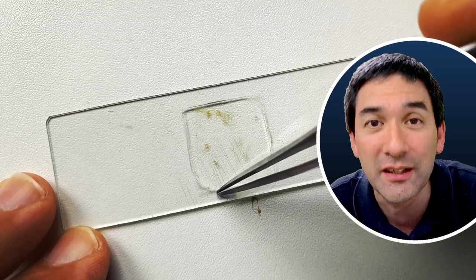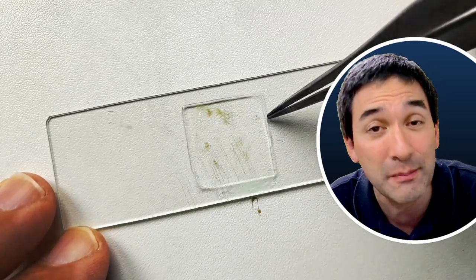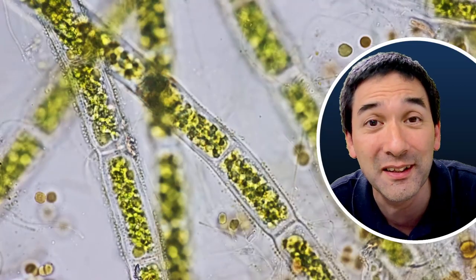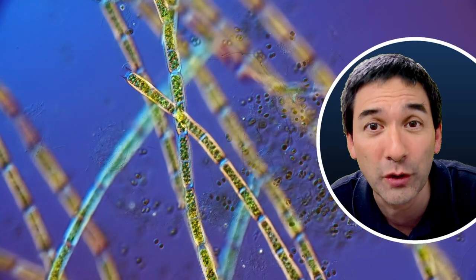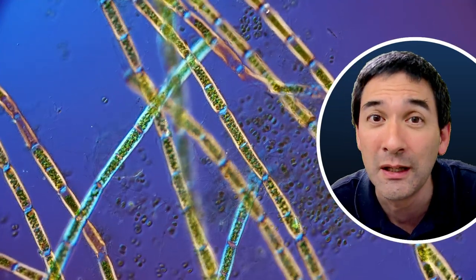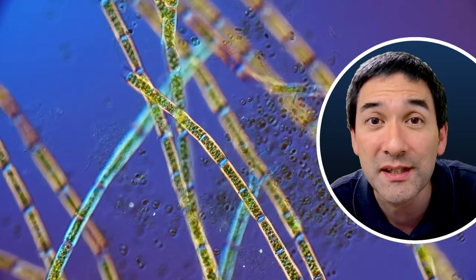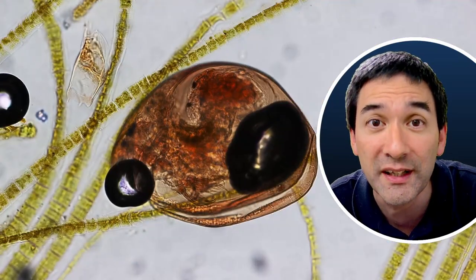I centered everything and then I let it dry for a few days and I was quite surprised that it worked quite well. The colors were retained, and generally the structure of the specimen was retained quite well. This is something that we do not always see when we're using mounting media that contains solvents.